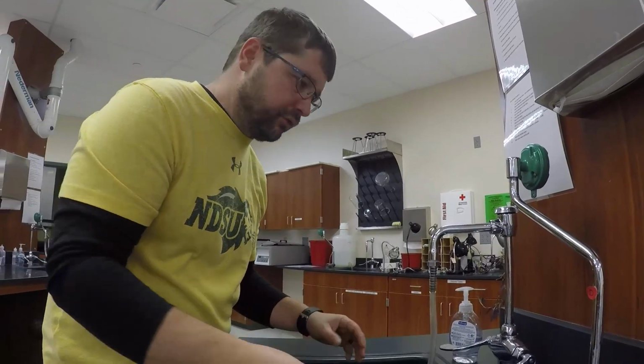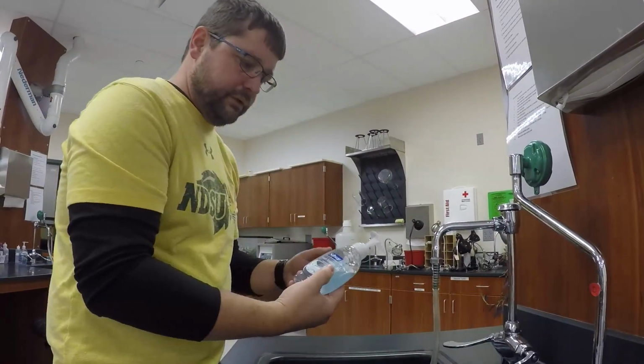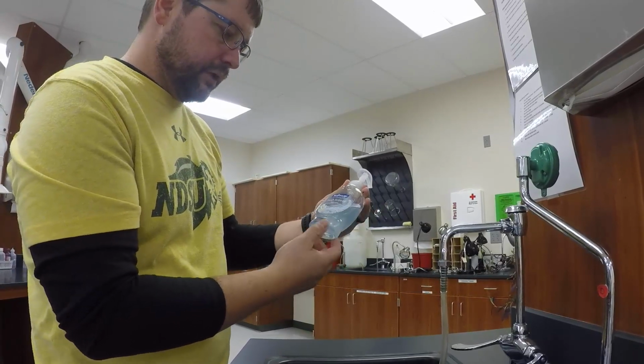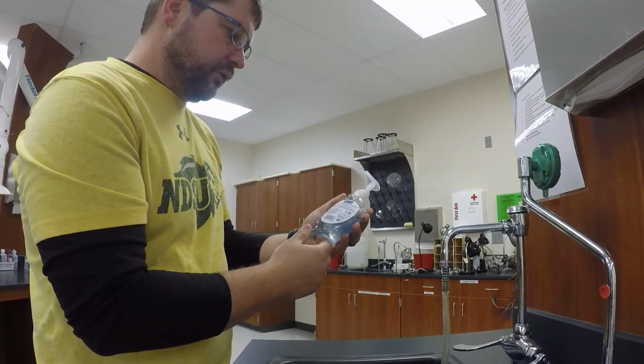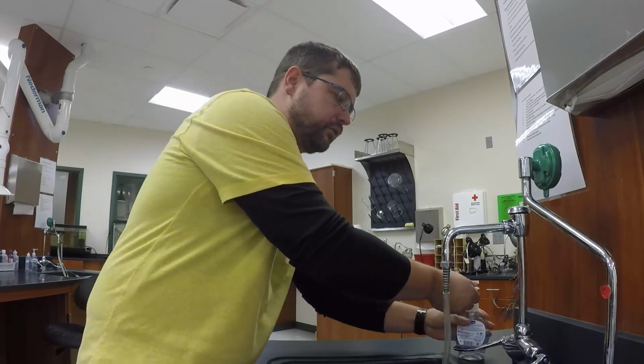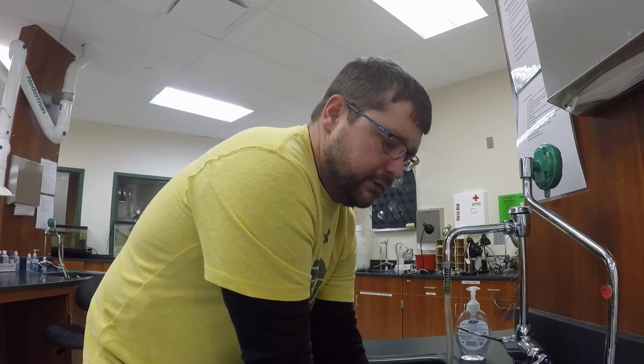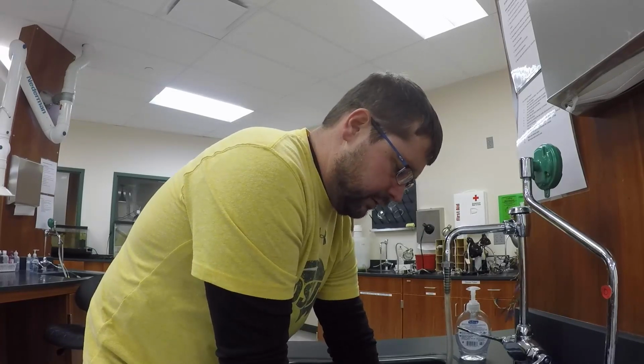In this case, I'm just going to wash it with soft soap, Fresh Breeze, hand soap. Okay. This is an antibacterial hand soap. So I'm just going to wash my hands. Most of you have seen somebody wash their hands before, so this is probably not all that interesting. But I'm just going to wash my hands for a little bit of time. I'll probably do it for 1 minute or so.